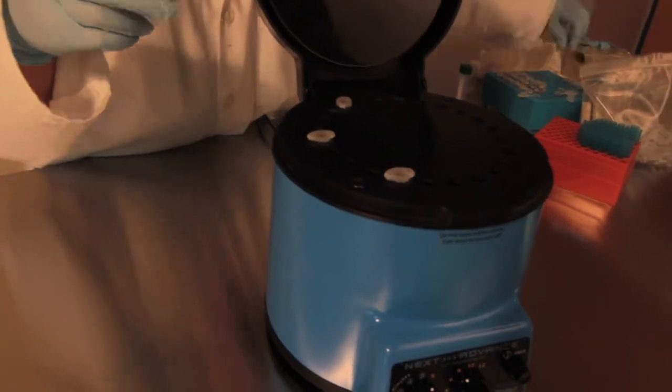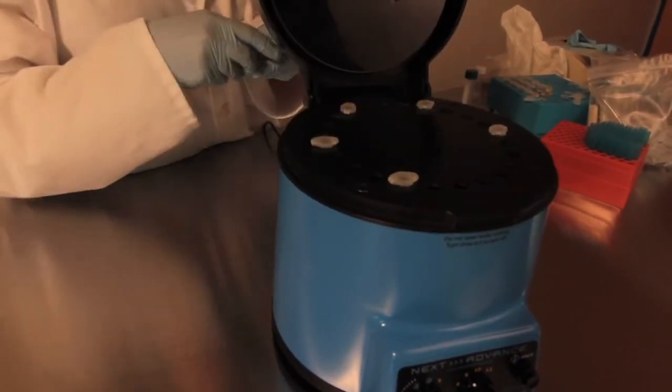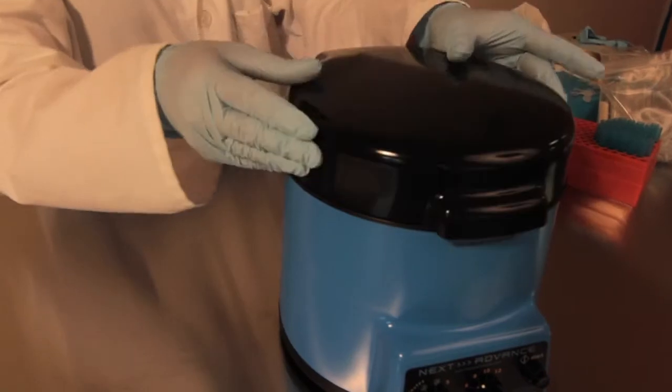I have samples loaded. I'm going to set the speed to 8 and the time to 5 minutes. Close the lid and press start.